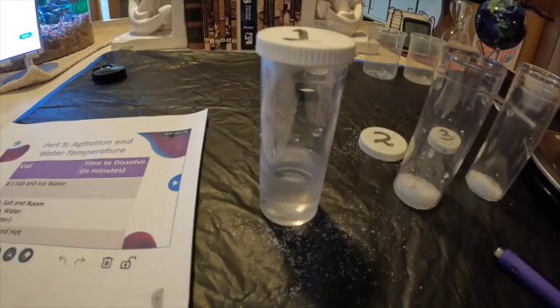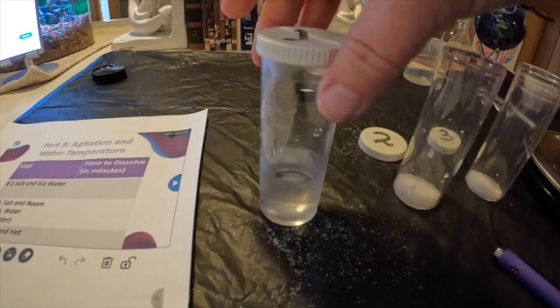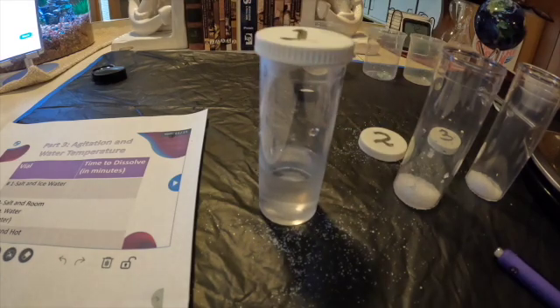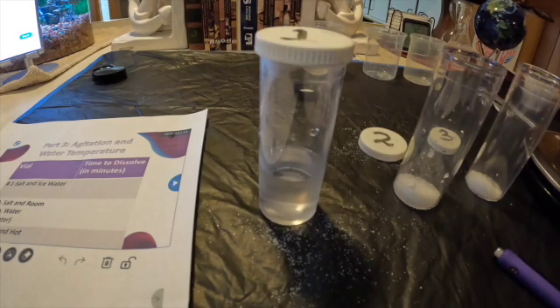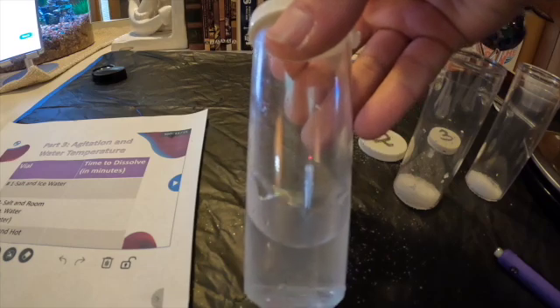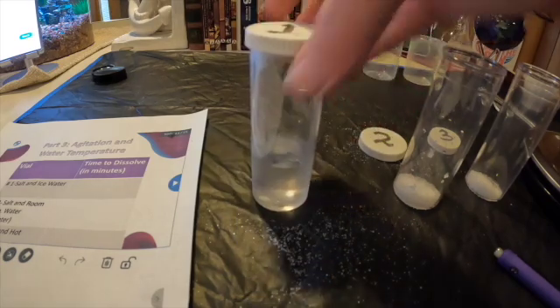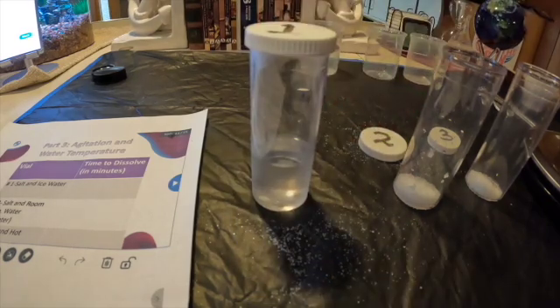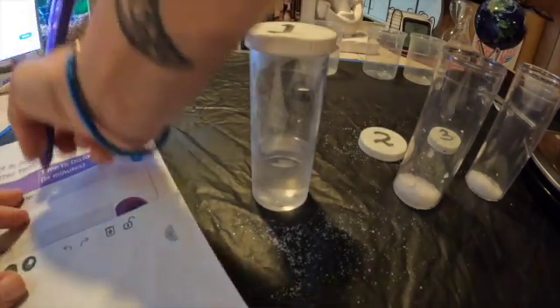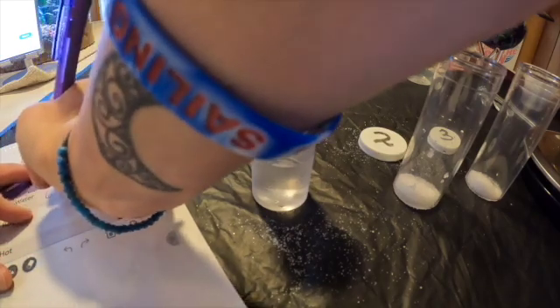For vial number one with the ice water, it took approximately six minutes for it to dissolve. In our chart, I'm going to record six minutes.